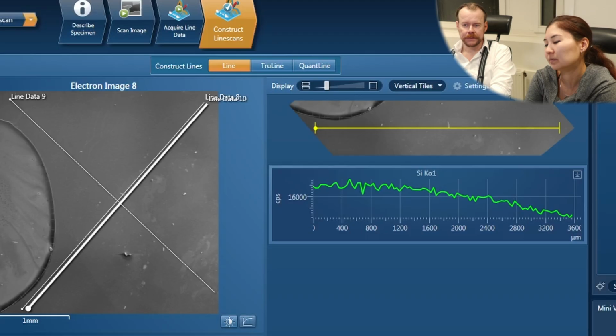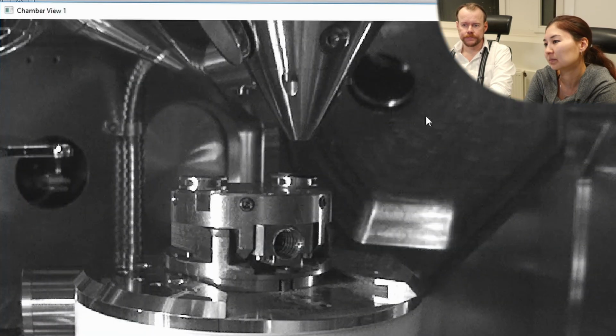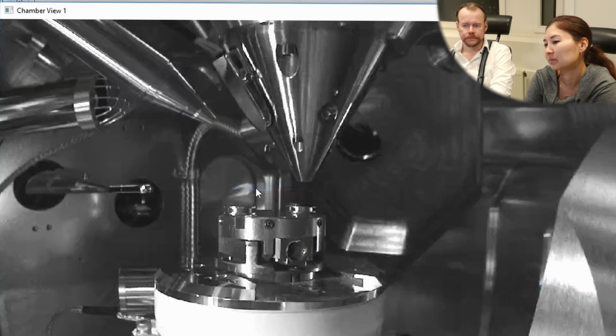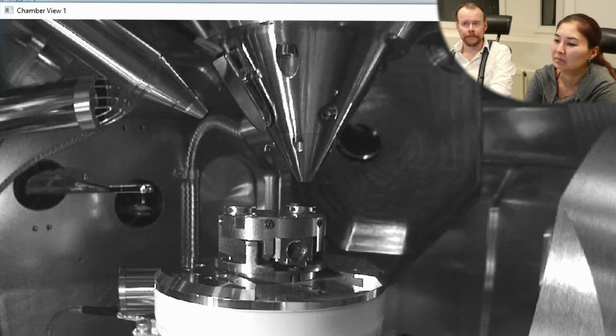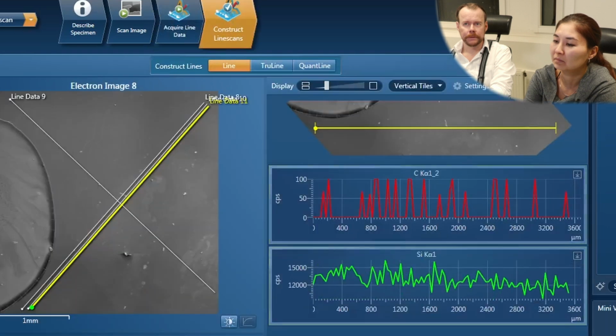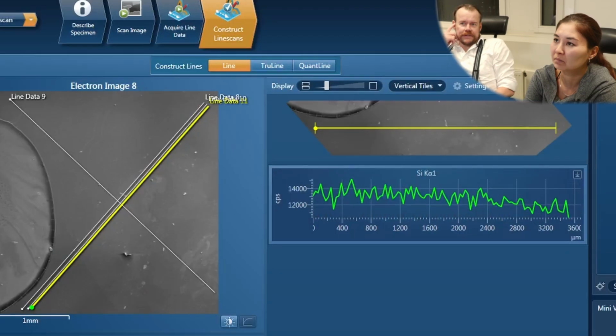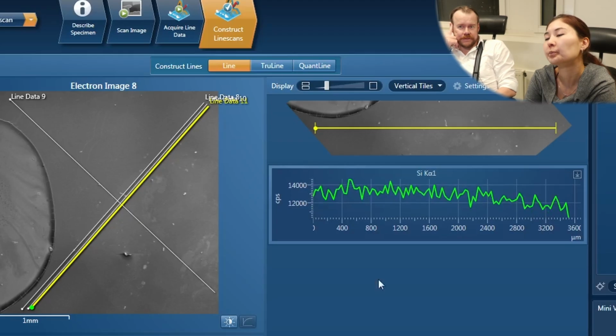So we can try to pull out the detector even further. Take it all the way back. This is the maximum position. Now you see it's almost flat. Yeah. So it's improved a lot.